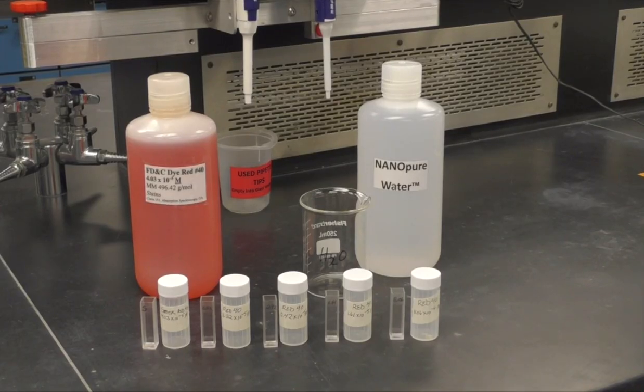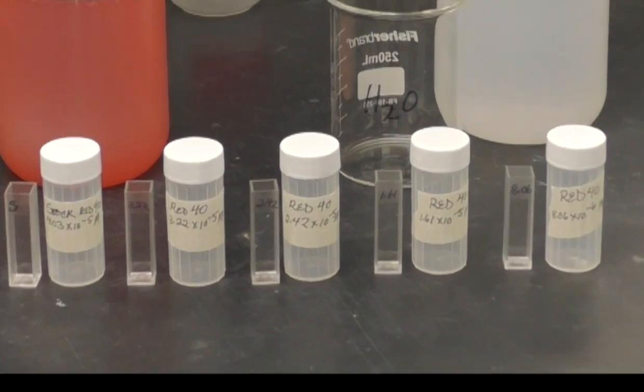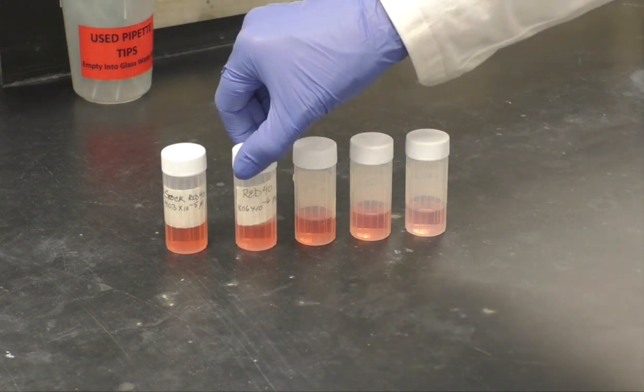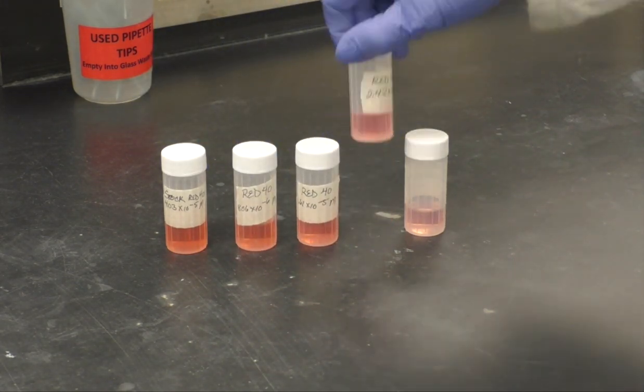Once you know the concentrations of each solution, it is very important to label your vials and cuvettes. Some dilution sets vary so little you may not be able to tell the difference by looking at them.